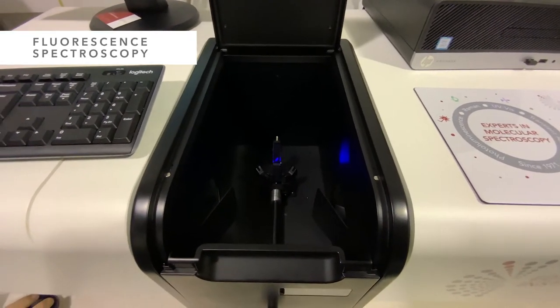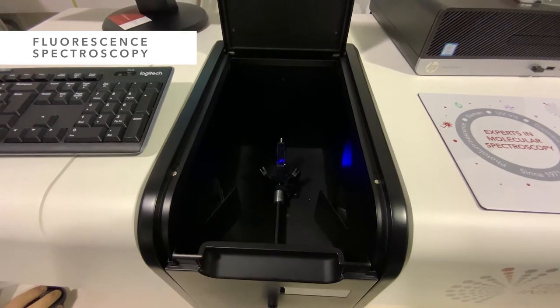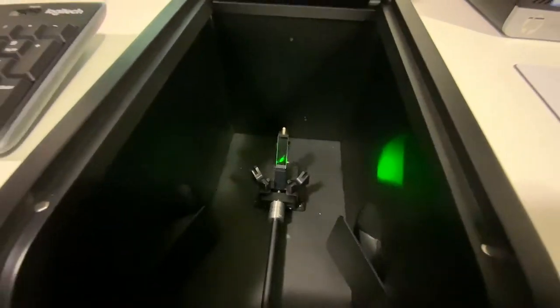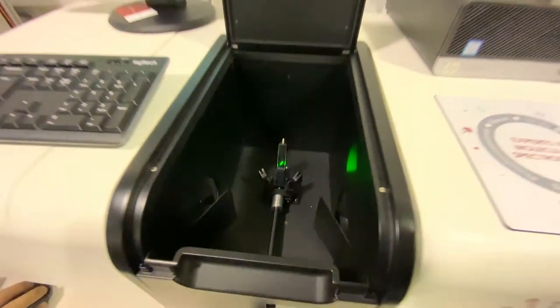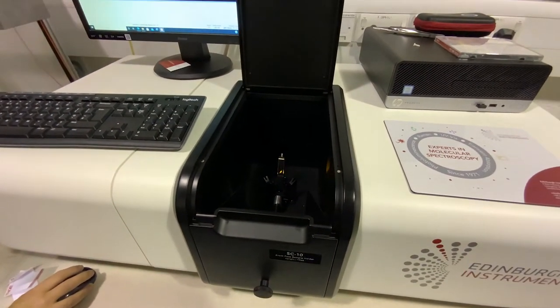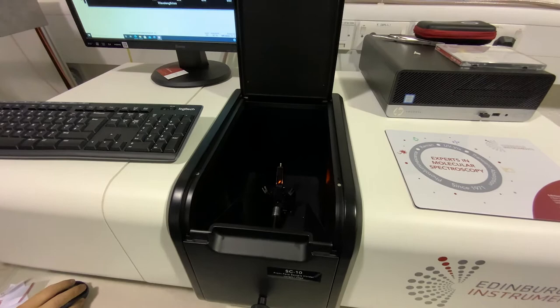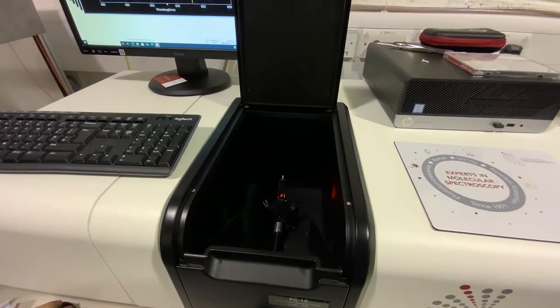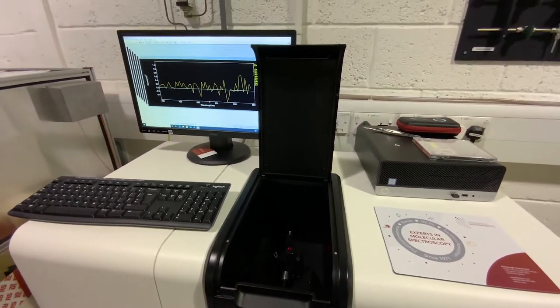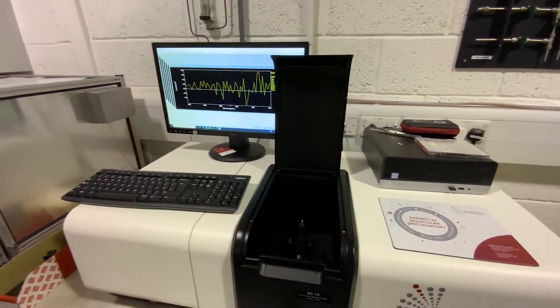To measure light emitted by a sample, we have our fluorescence spectrometer. The system operates between 200 and 800 nanometers and can be equipped with an integrating sphere to enable quantum yield measurements. As well as steady-state measurements, the system is capable of measuring phosphorescence lifetime.